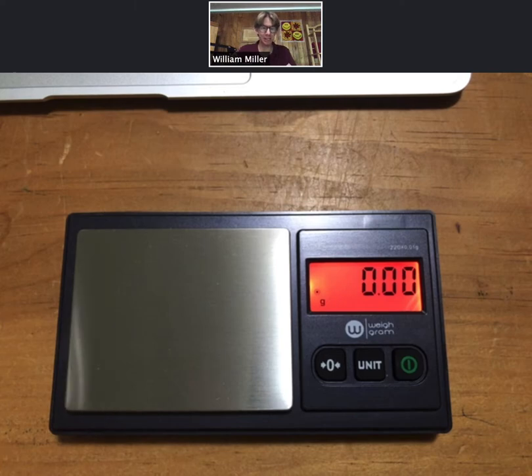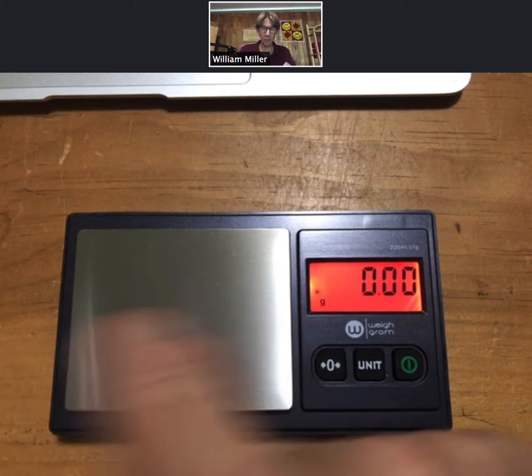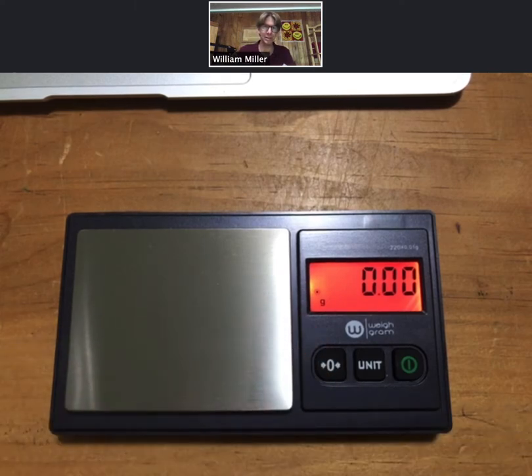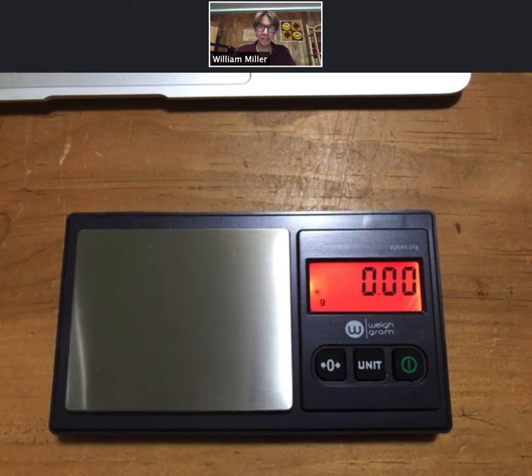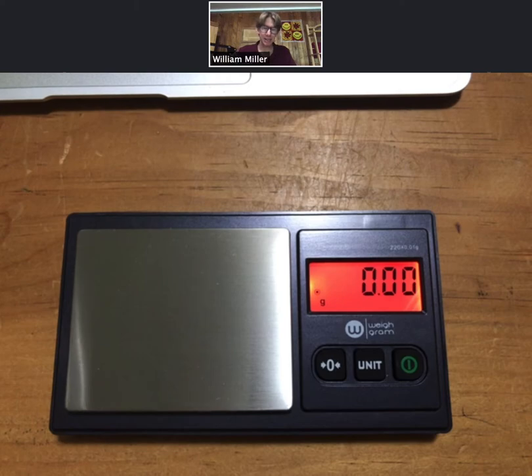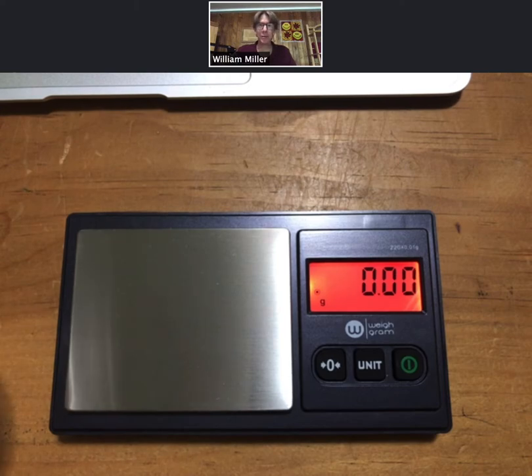A common mistake is to transfer water between these two, transfer solids, so we just want to be careful about that to make sure we get accurate measurements.